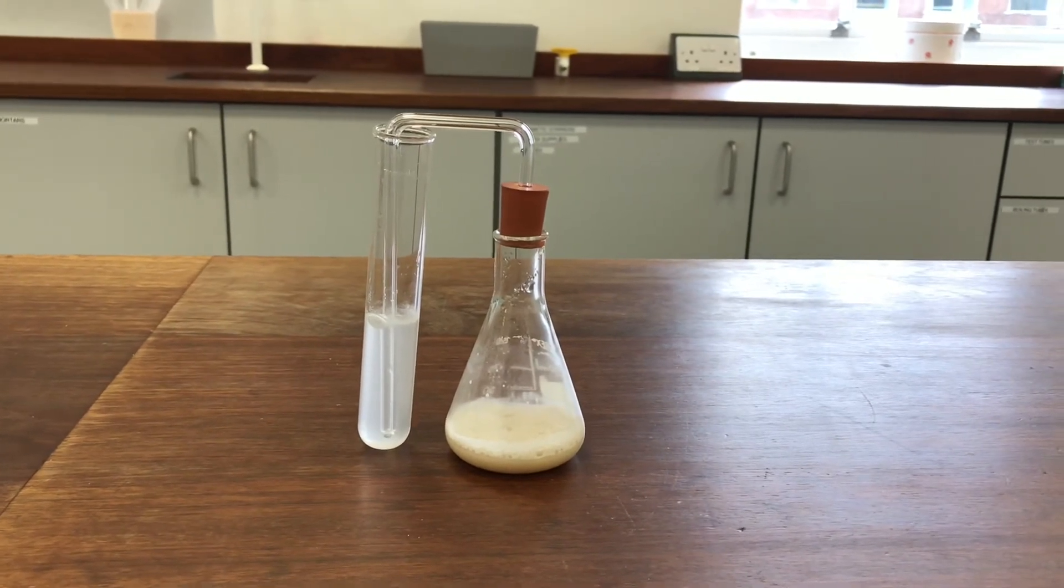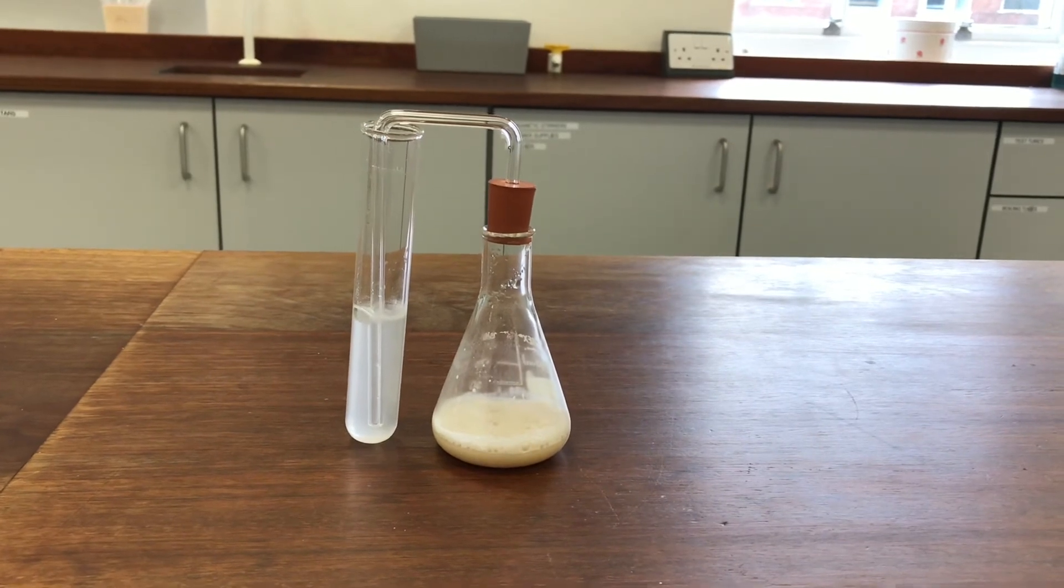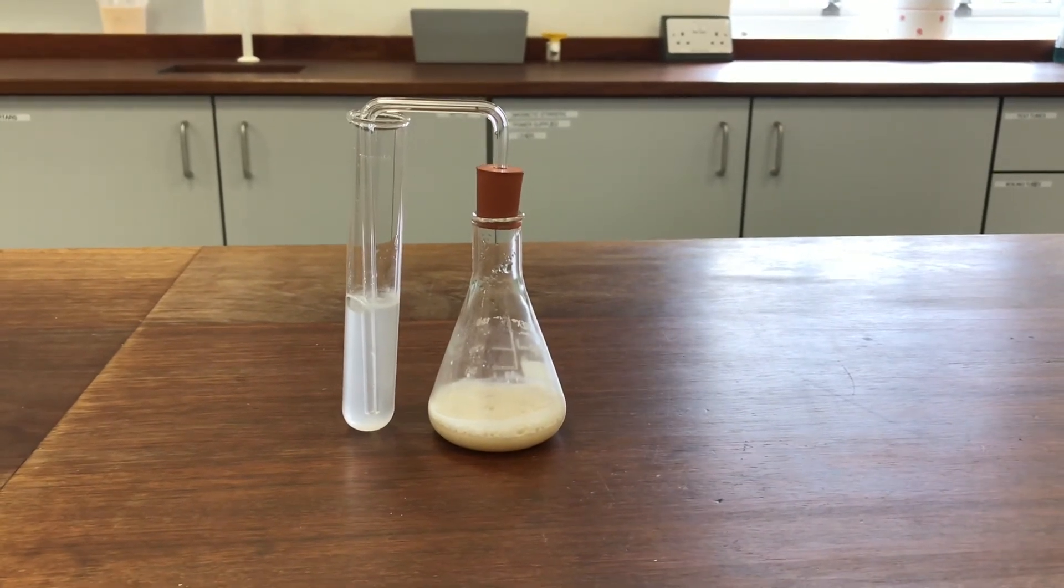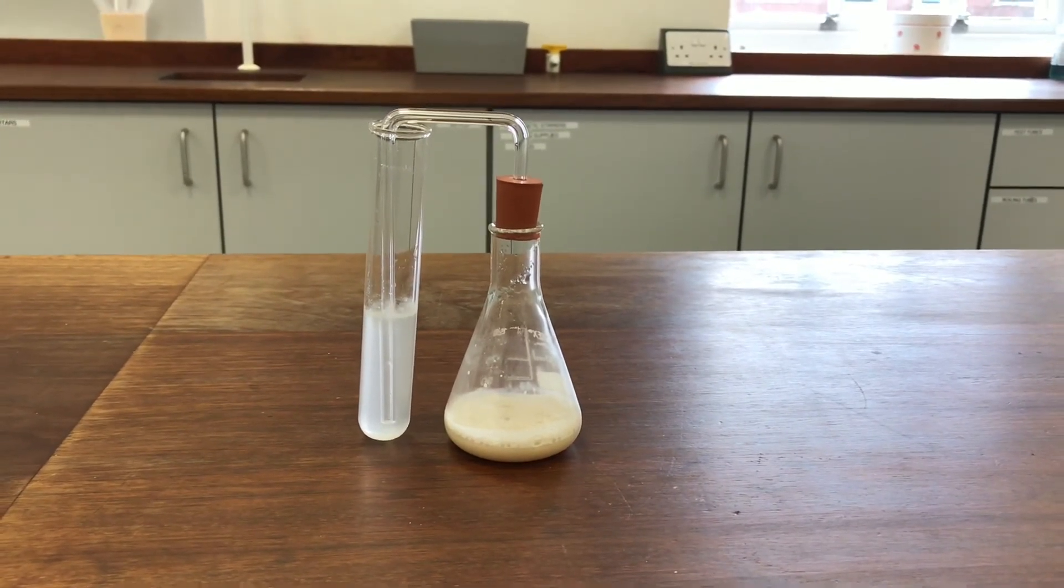There's a layer of foam all over the top of the yeast and sugar solution and there are little bubbles coming out of the end of the tube. And you can see the lime water's gone cloudy. So hopefully you're convinced that it's genuinely producing CO2 as that process is going on.